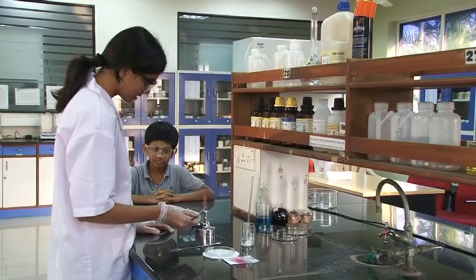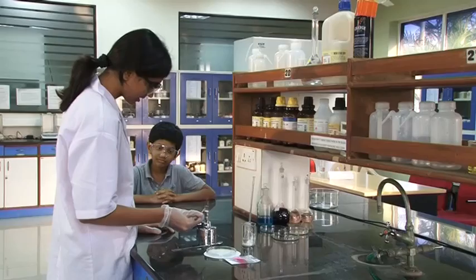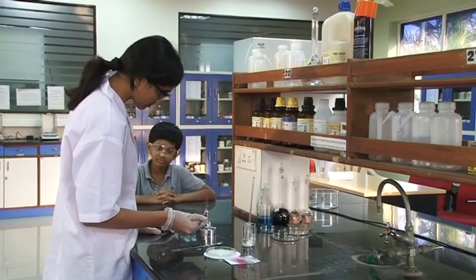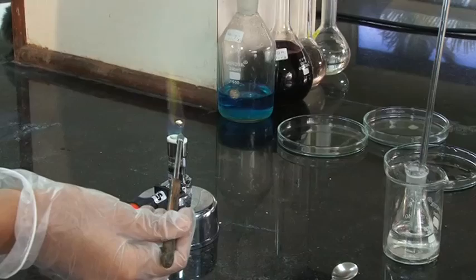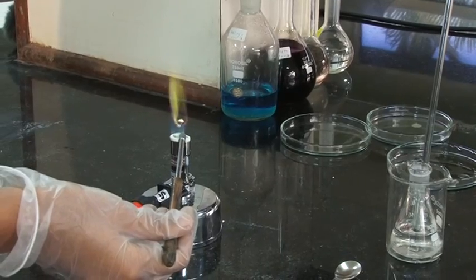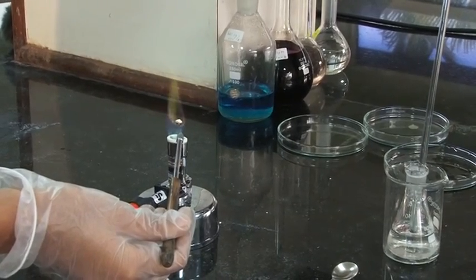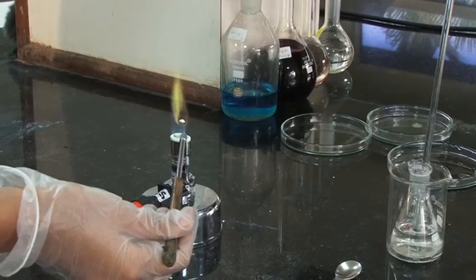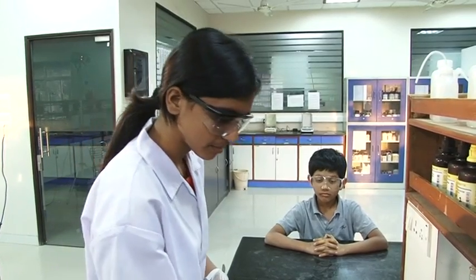This light green is due to barium. Pale green — barium. Yes, pale green for barium.